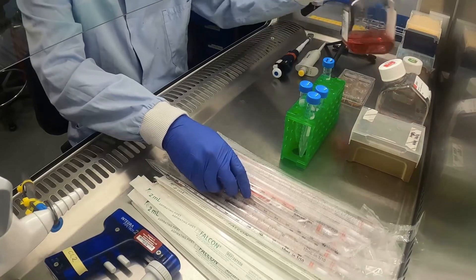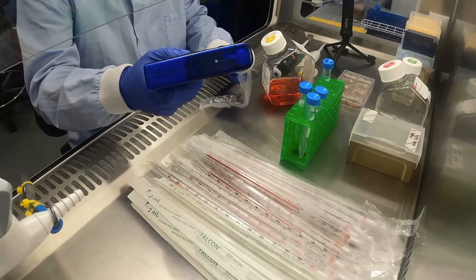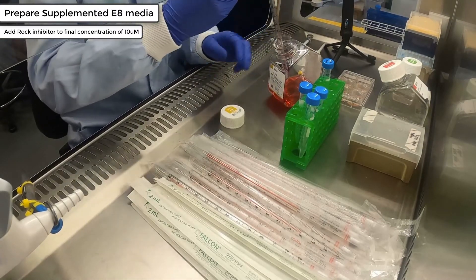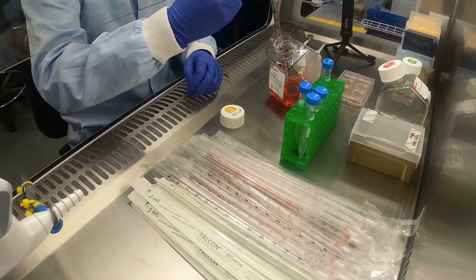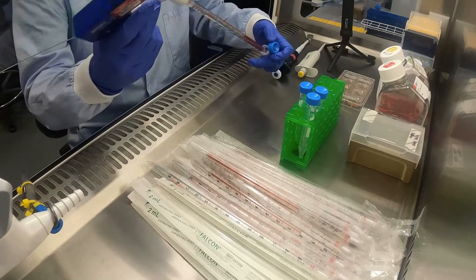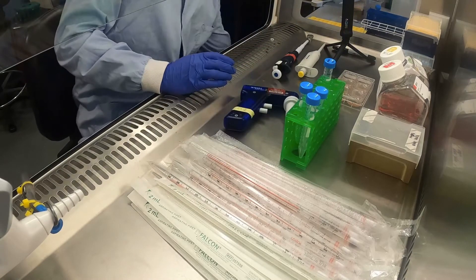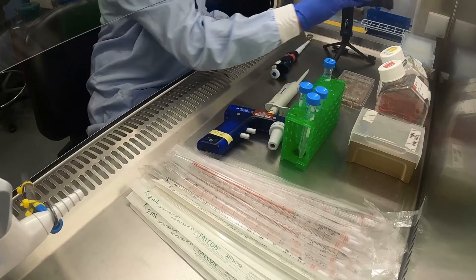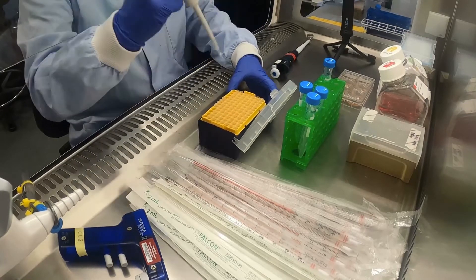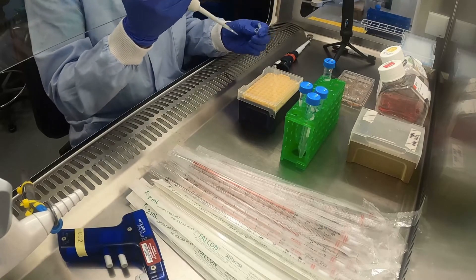Before you start, ensure you have a six-well plate coated with vitronectin and at least one well of confluent iPSCs. First, prepare a working solution of E8 plus rock inhibitor by diluting your 10 millimolar rock inhibitor in E8 media to form a one-in-a-thousand dilution. Here, Luke is taking five millilitres of E8 media and adding it to a falcon tube, then adding five microlitres of rock inhibitor.